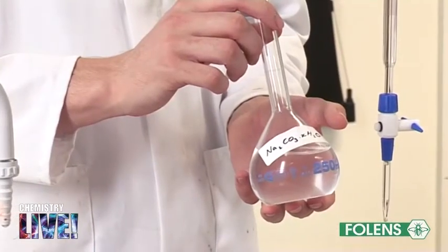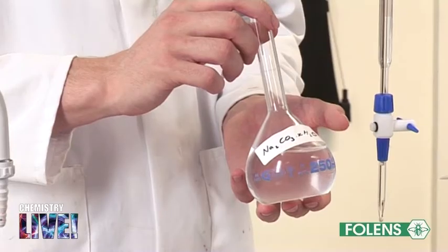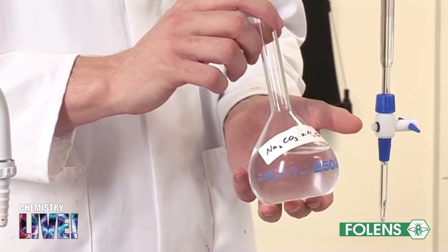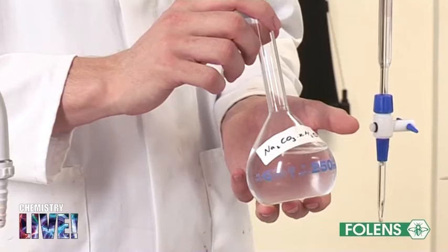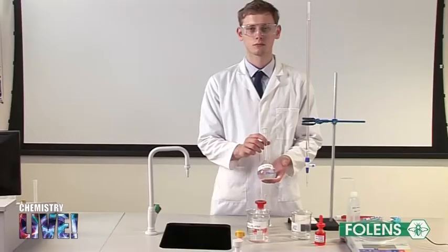The solution was transferred to a 250 centimeters cubed volumetric flask, taking all the usual precautions to avoid loss of solution. The solution was made up to the mark in the usual manner and inverted in the volumetric flask about 20 times.